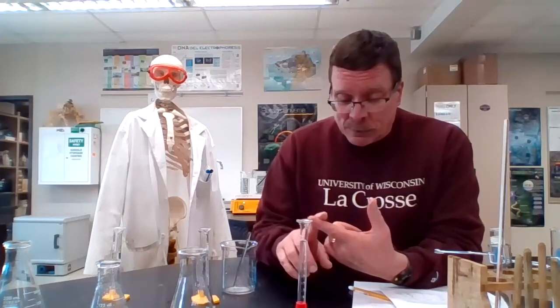We are back again. I'm here with my trusty lab assistant over my shoulder, and this is part two, day two of the reaction rate lab. Yesterday, of course, we did part one, and that was a concentration sample. We have learned and seen in demonstrations that there are four factors that we really look at for changing reaction rate. Concentration we did yesterday, and we worked on different concentrations of a couple different substances, and we'll be analyzing how that affects the reaction rate in relation to what we've learned in class.